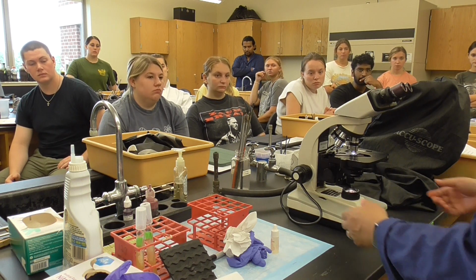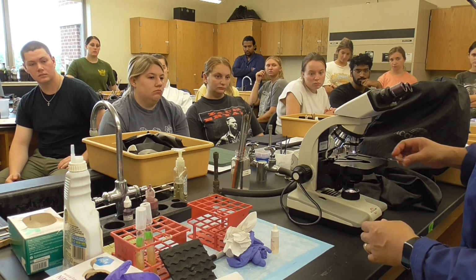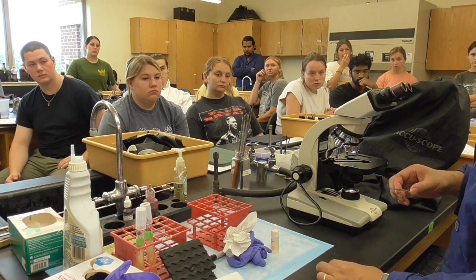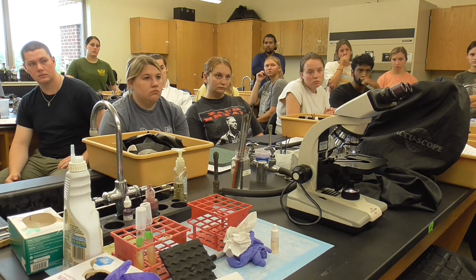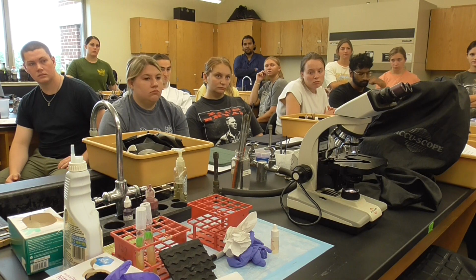Okay, so that's the procedure we have. Now when you take it out, don't throw them away, just clean it. Or you can just keep this one in your box. Okay, then the next one we're going to do the Gram stain, you can have something collected in your own sample. Okay, so that's all we have.